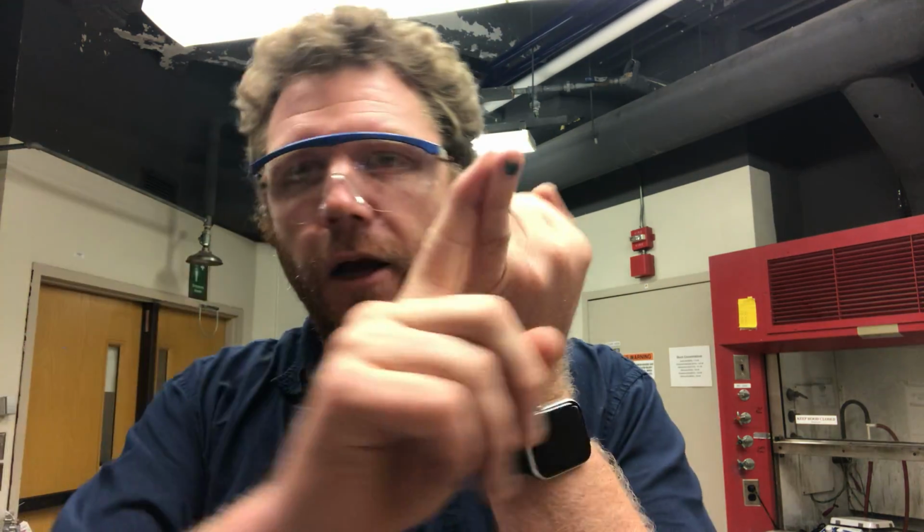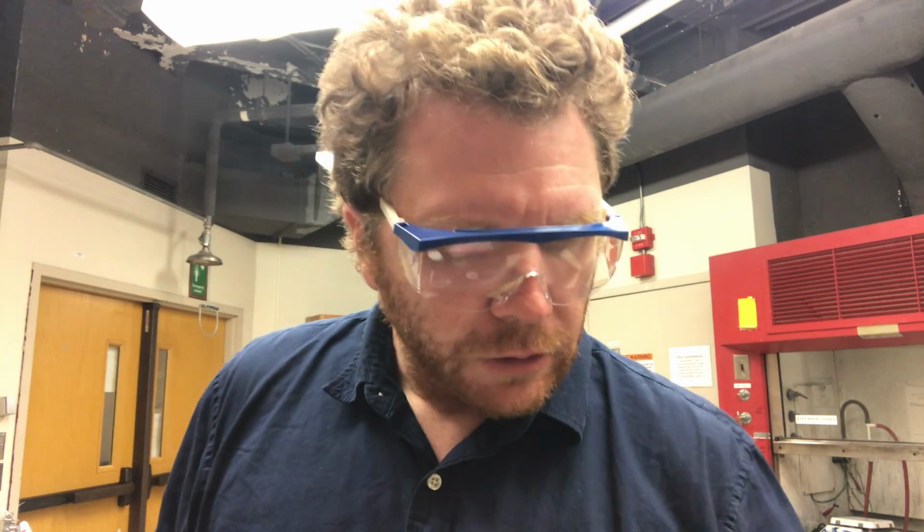So it's a chemical reaction in which my calcium carbonate goes into solution and then breaks down into a carbonate ion and calcium ions. And that carbonate ion subsequently converts into carbon dioxide, which is broken down and released. So that in a nutshell is what this lab consists of, where you separate these components, and we're learning how to separate them and evaluate basically what's the composition of this.